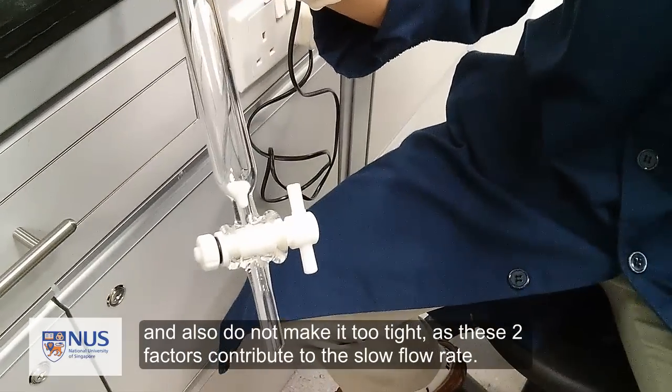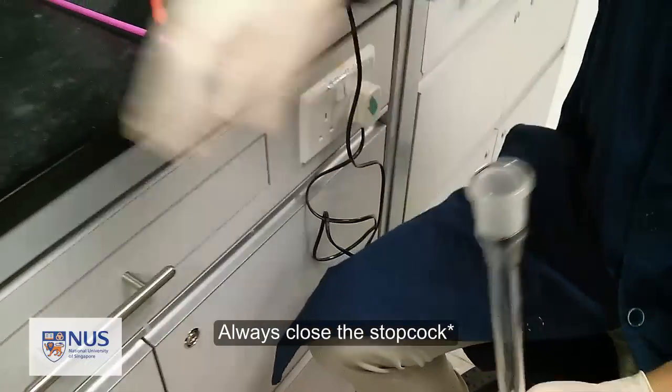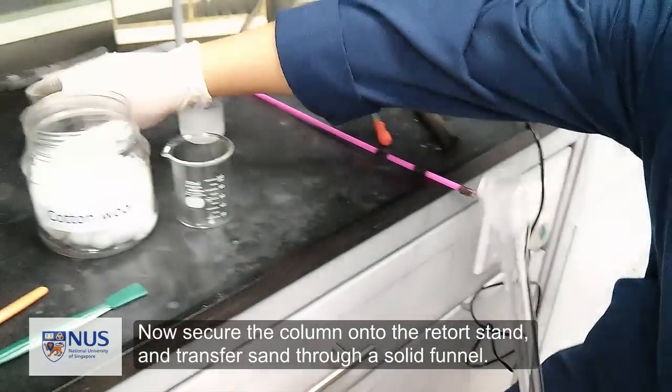And also do not make it too tight, as these two factors contribute to slow flow rate. Now secure the column onto the retort stand.